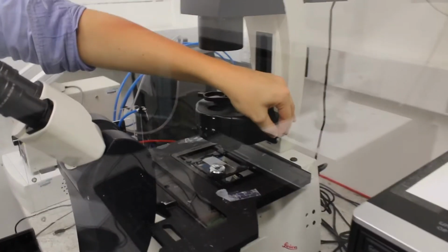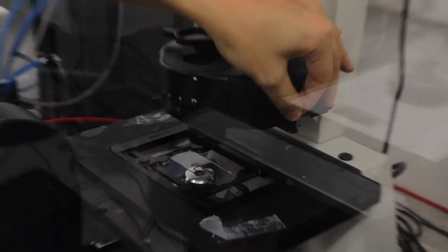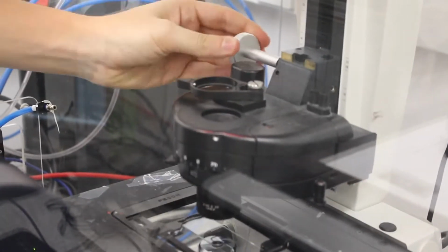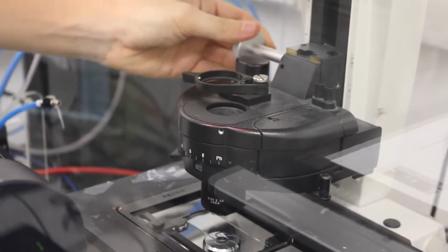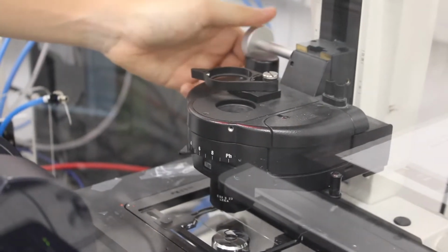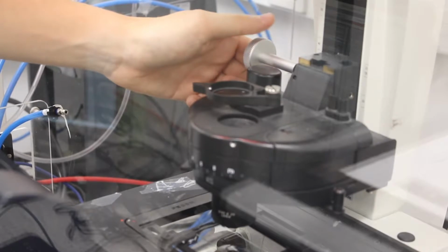Now I'm going to show you how to align the condenser lens. The condenser lens, you are going to use it for the objective 10 or more. You should just put it on or off by pushing it or pulling it towards you. But don't change the focus of the condenser lens here, because this will change how the image looks. It will be more blurry if it's not properly aligned or properly focused.